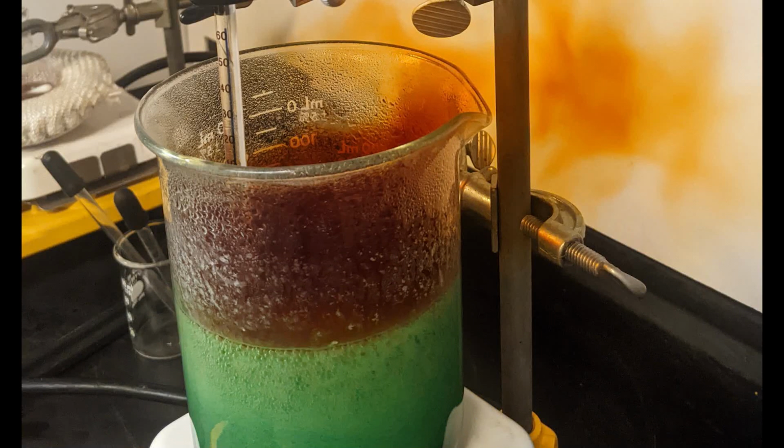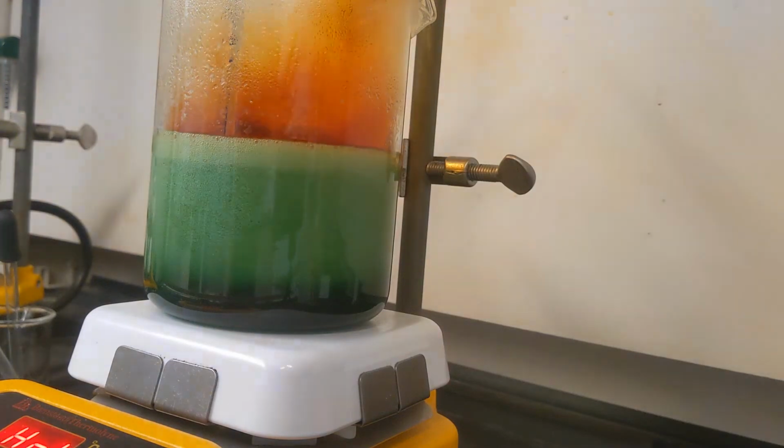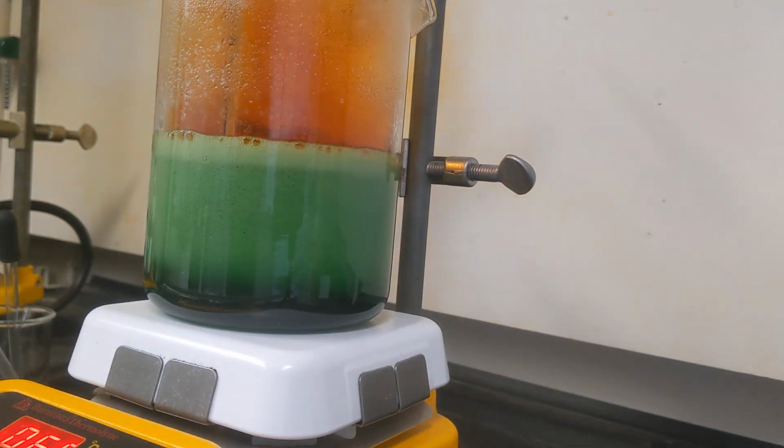It's a cool picture, and that gas wasn't unexpected, but it's no joke. And you know, you have to be really, really careful to make sure you don't cause an accident that hurts you or others.